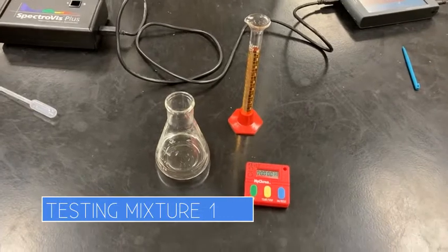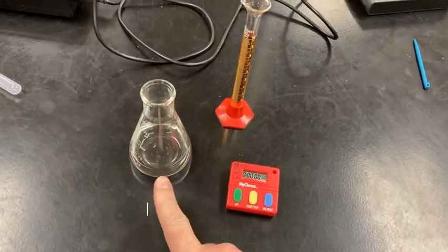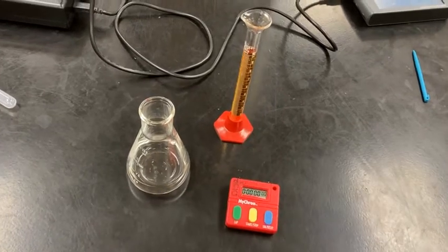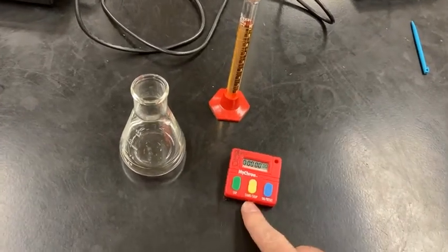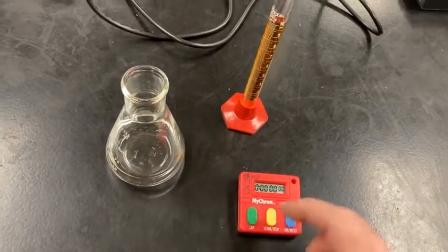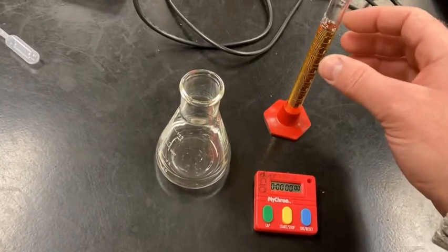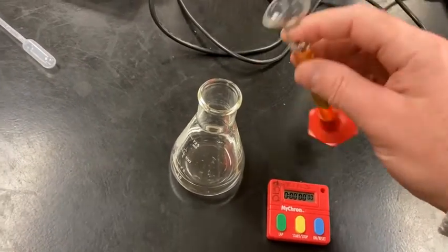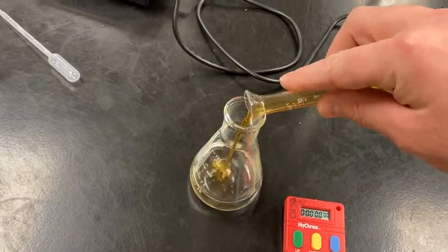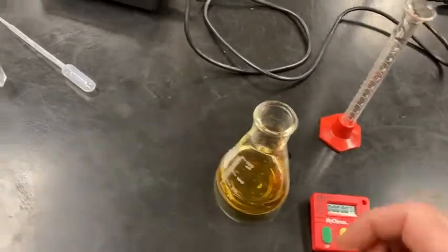Okay, let's do trial 1. So I've mixed my HCl, water, and acetone together in the flask. All I have to do is add the iodine, and I've got my stopwatch ready. So as soon as I add the iodine, I will hit start for my time and then get it into the absorbance. So let's add this. Let's start it.